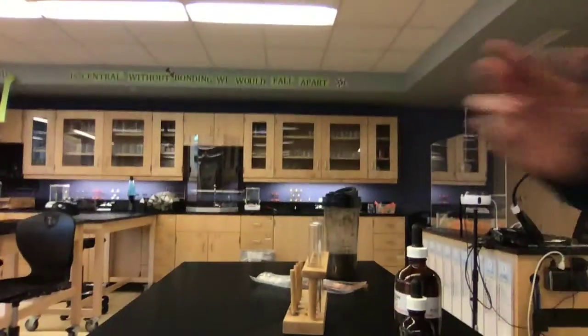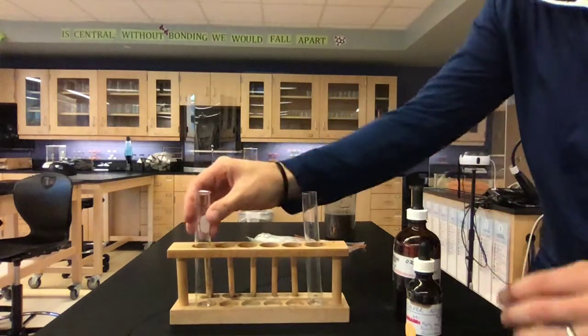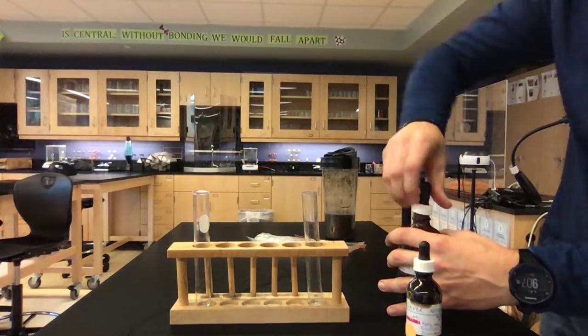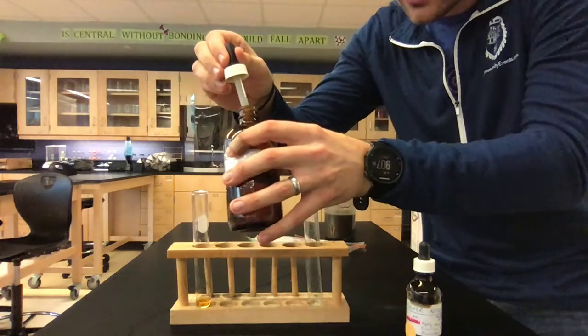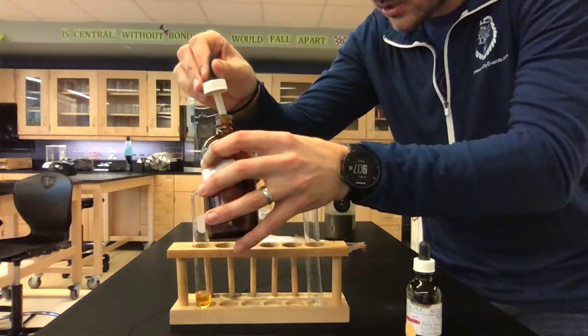So I'm going to go ahead first. I'll turn you sideways so you can see what's going on. I'm going to go ahead and put silver into this test tube and iron into this test tube. So iron nitrate is going in the test tube over here. Ooh, look at the color. It's like a yellow color. It's not spoiled. That's just the color of iron ions in solution.